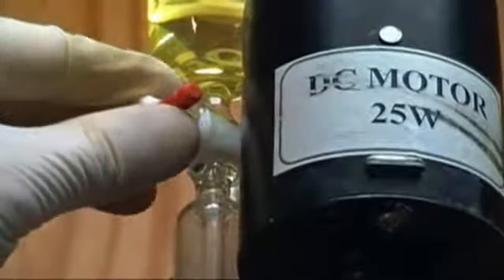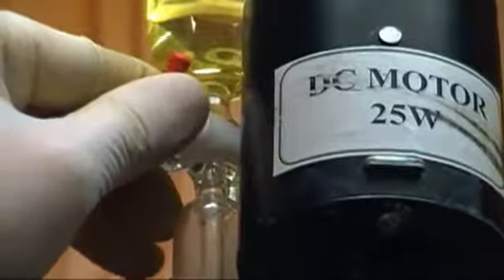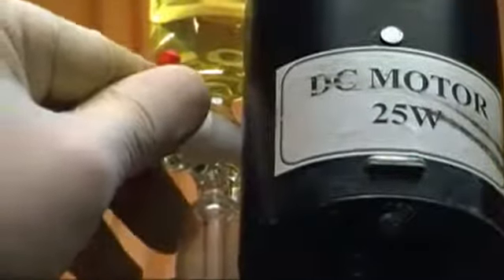Turn on the heat to your hot plate and add about 5 milliliters of nitrobenzene. The mixture will begin a light gray but will go to a dark black after a few minutes. Heat the mixture with the hot plate to about 80 degrees C. Once you reach that temperature, remove the hot plate.